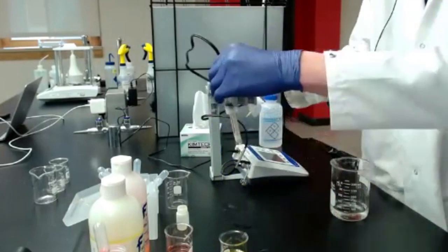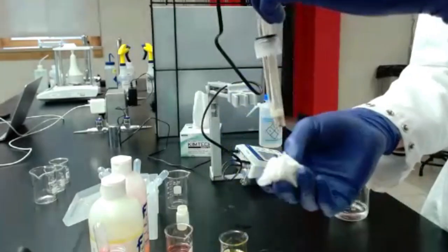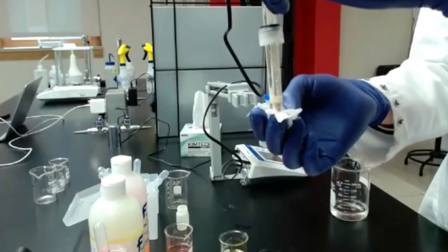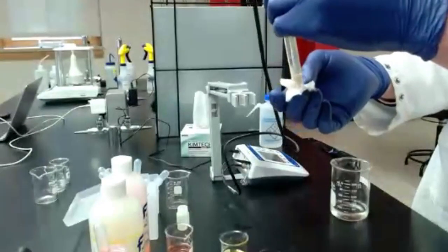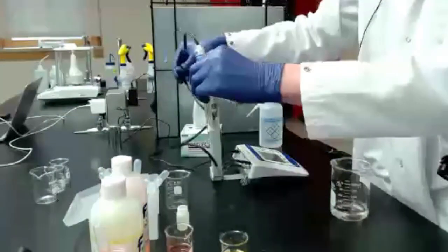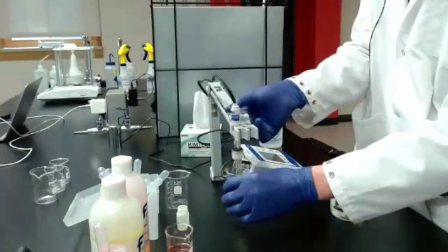When you're cleaning off the pH probes, make sure to get all the way around and then gently dab the bottom of the probe to absorb any water droplets that are there. But you really don't want to disrupt the little glass bulb that's there, because I don't know how well you'll be able to see it, but that is fragile and it's filled with that silver chloride and the reference electrodes, and they can be damaged quite easily. So be gentle. This equipment does a lot of work for us, so we want to be nice.